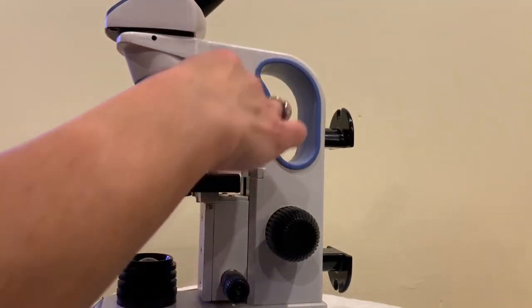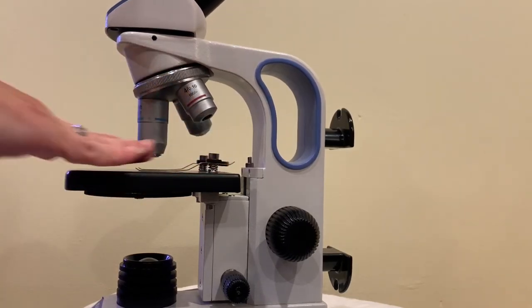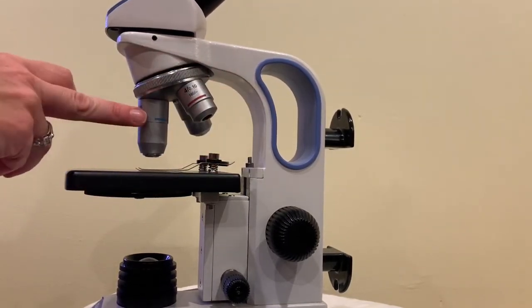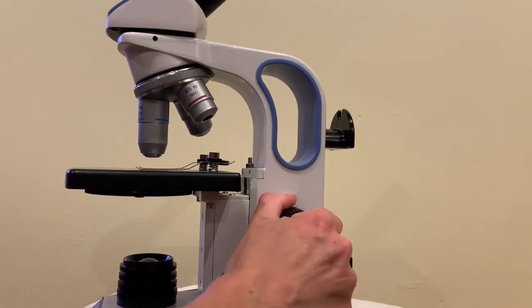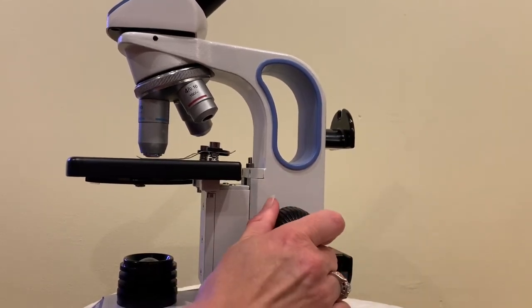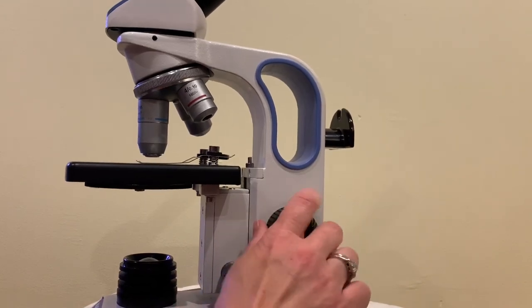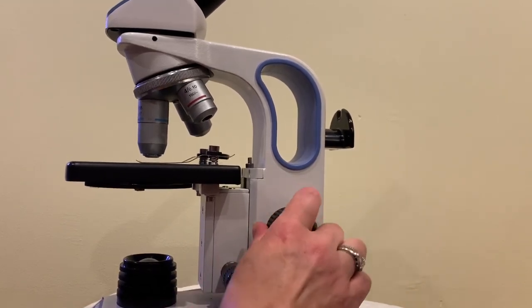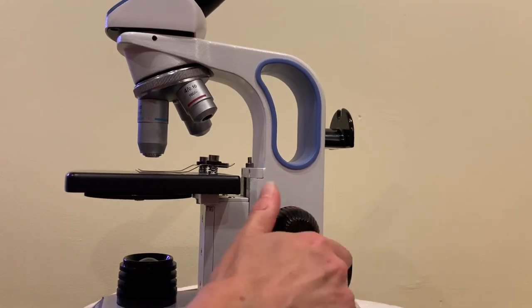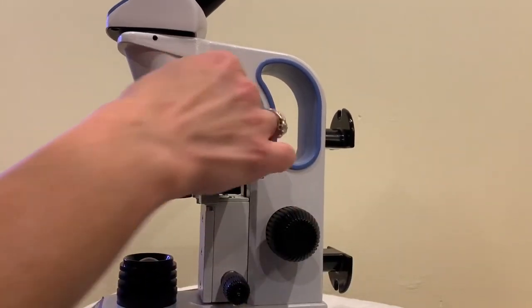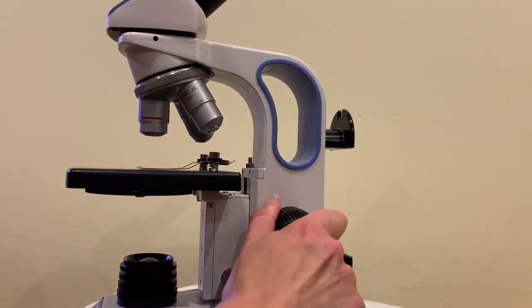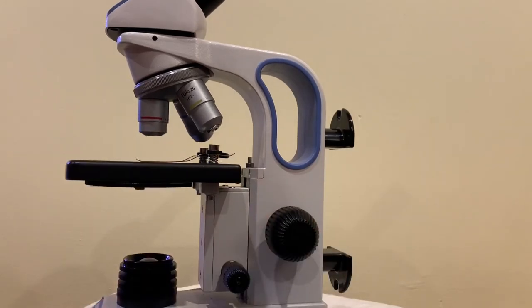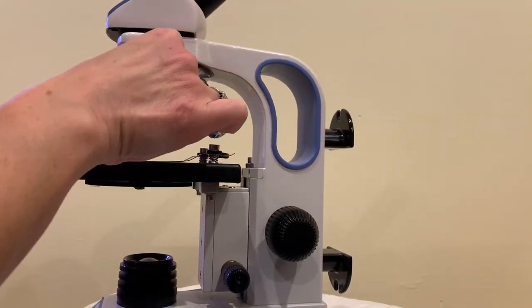Now if you decide to go and start your slide on the highest magnification, you're never going to be able to get your sample in focus. Also you have a very high chance of breaking your slide by slamming the stage into the objective lens. So that's a big no-no so we're not going to need to do that. Always start on the lowest objective. Get it into focus.